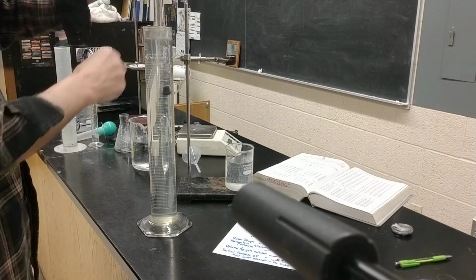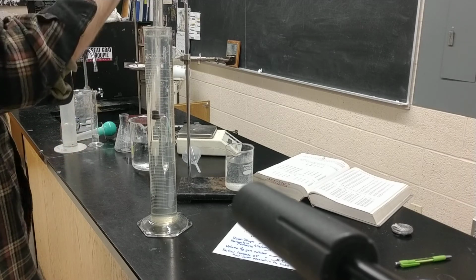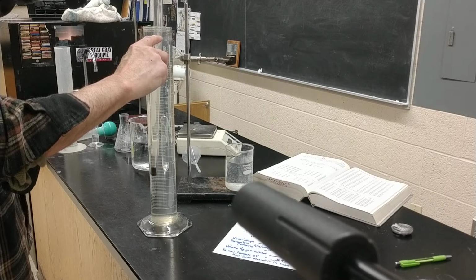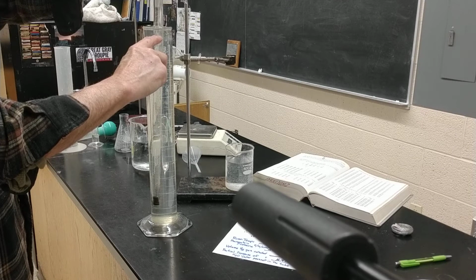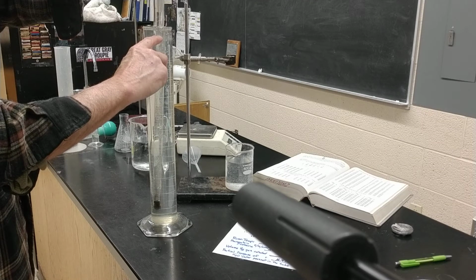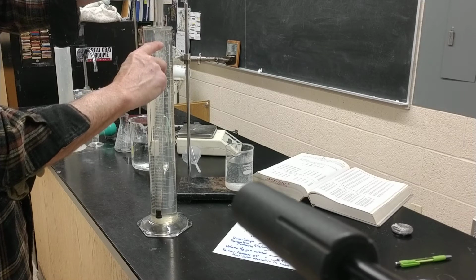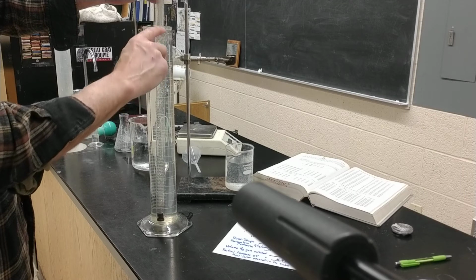So now the purpose of this column is to equalize this level with this level right here. So I have to, it's going to be close. Ooh, I'm getting close to the end point. I might have to adjust this a little bit. Yeah, I'm losing it a little bit, but right now it's equalized.